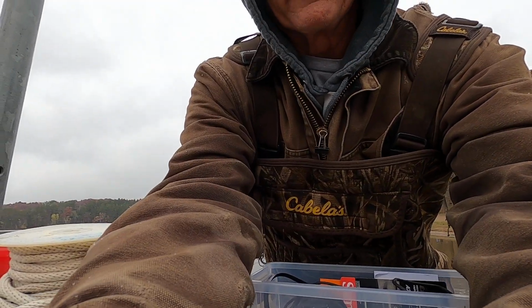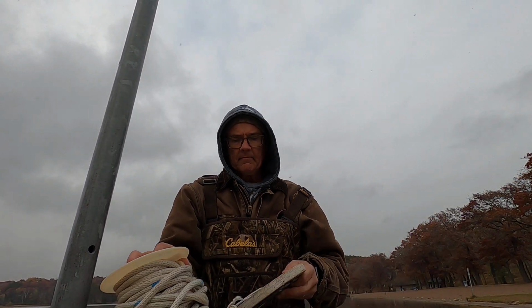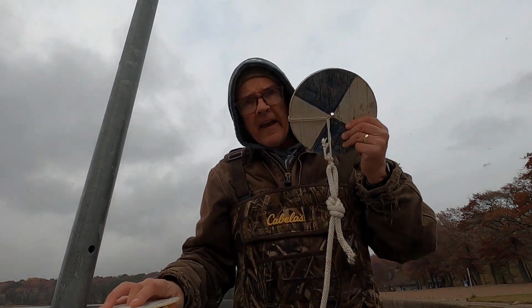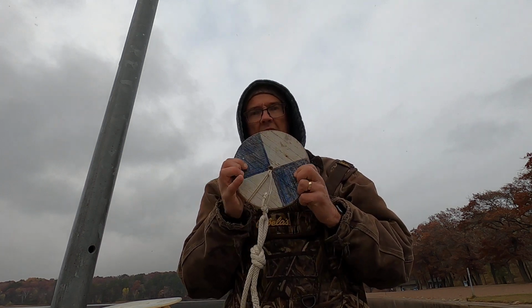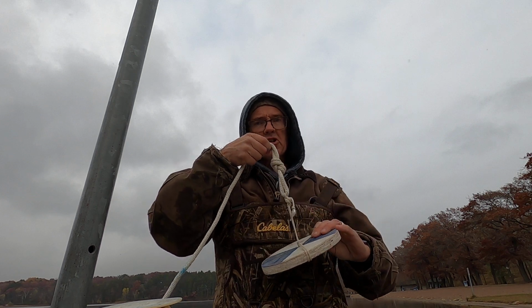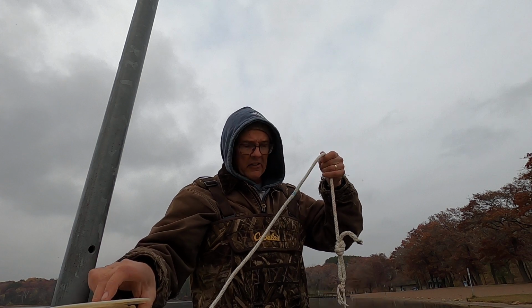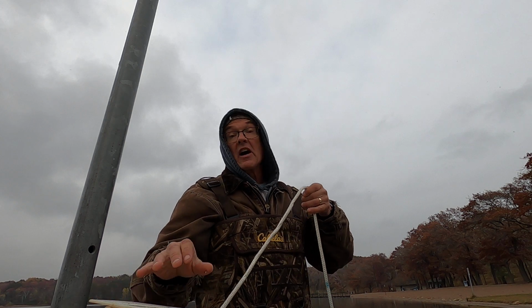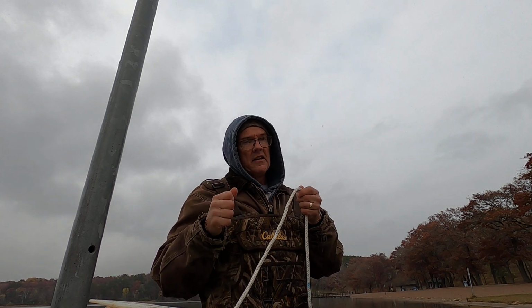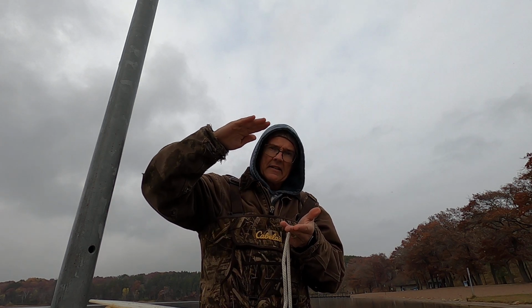So let me show you a few things. I'm going to put a little bit of an angle here so you can see. This is what's known as a Secchi disc. A Secchi disc is an agreed upon width, and usually with a pattern like this. And the idea is you can measure water clarity, we call that turbidity. We can measure the turbidity of a lake by lowering this Secchi disc. And when it sinks to the bottom, if it gets all the way to the bottom, that would be great. In a lot of lakes, at the point at which that disc disappears from view, we measure how much rope that is, that distance.